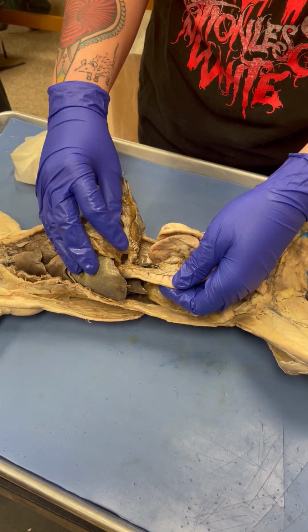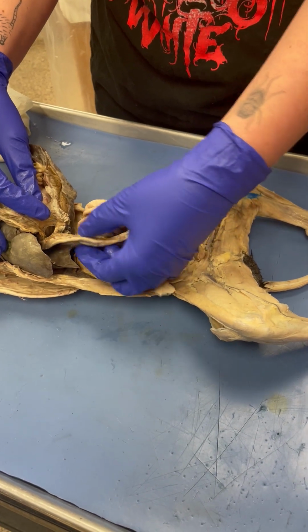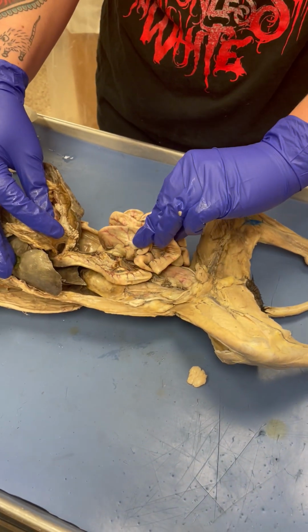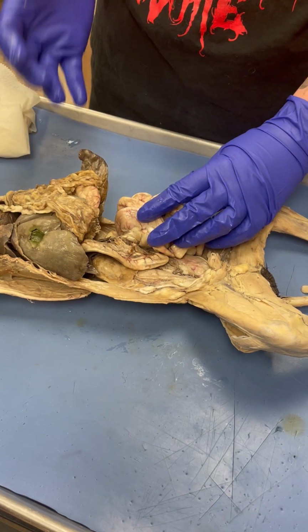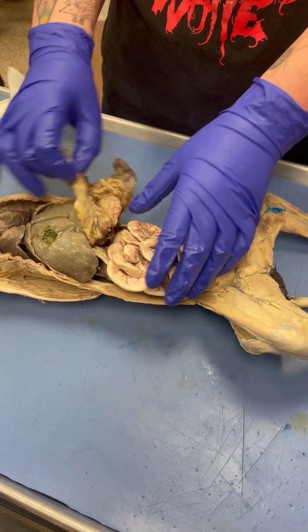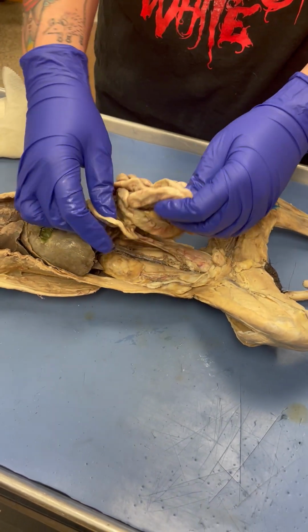I can't ever see that anywhere else. See, it's this white bumpy tissue. That's all pancreas? That's the pancreas. Whoa, that's cool. Looks like styrofoam. Yeah. This is kind of how endocrine tissue looks. It all has a similar appearance to it. Interesting. Okay. So the first part of the small intestine is the duodenum.